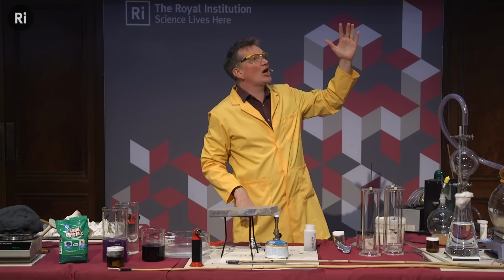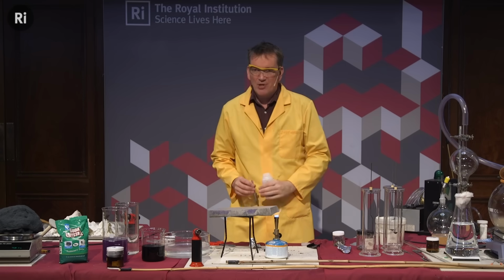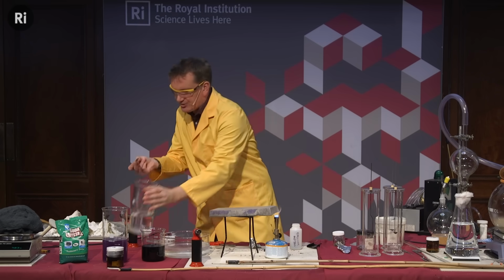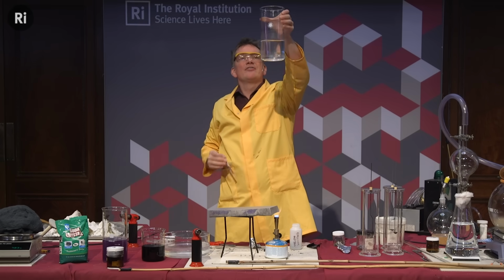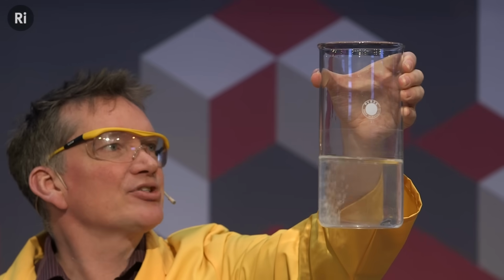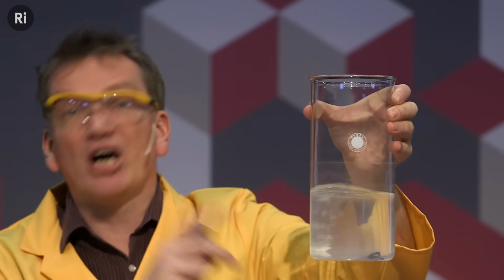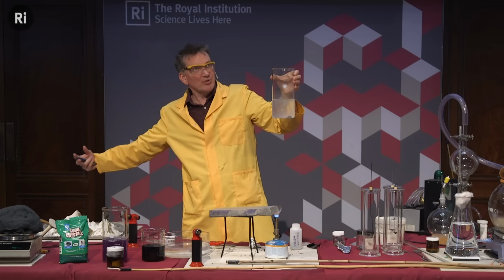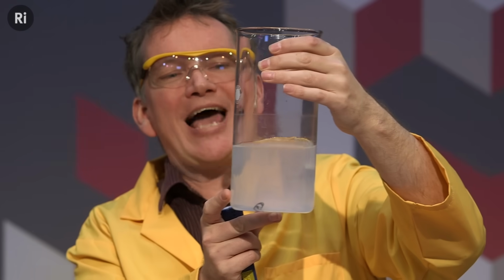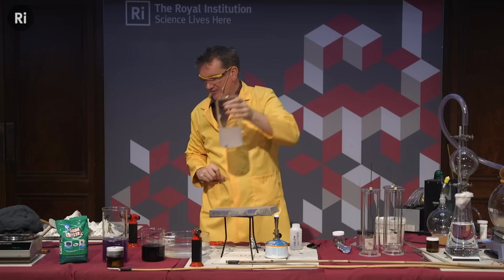But if I pick the element underneath magnesium, well, this is calcium, this one does react a little bit more vigorously. So if I take a little piece of calcium, so here is some calcium, adding this to the water, again, the calcium sinks, but instantly we're getting bubbles of hydrogen gas given out here. The chemical reaction is the calcium reacts with the water to form calcium hydroxide. Well, that's the same substance that we made here from the reaction with our calcium oxide with water. So we're making calcium hydroxide. That's what's making the water go very cloudy here at the moment, because it doesn't really dissolve very well, but we're also getting hydrogen gas there given out.